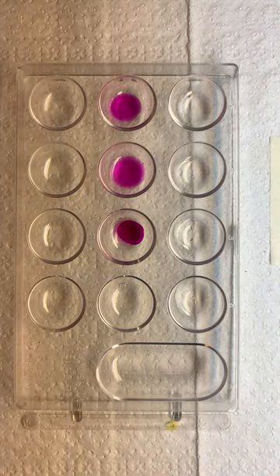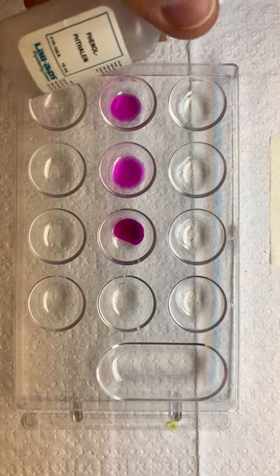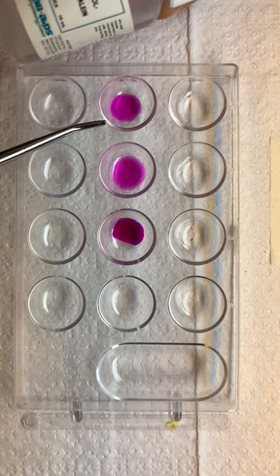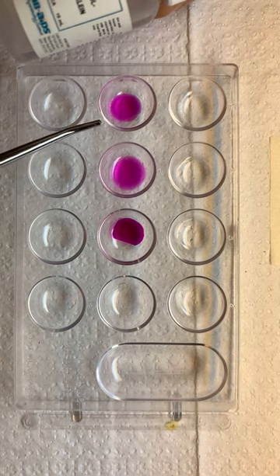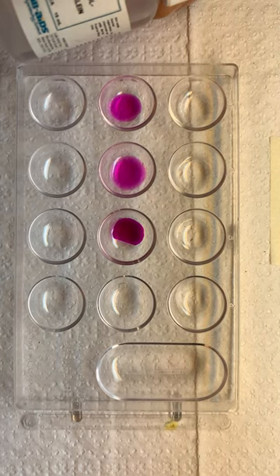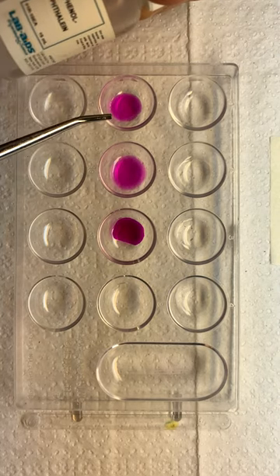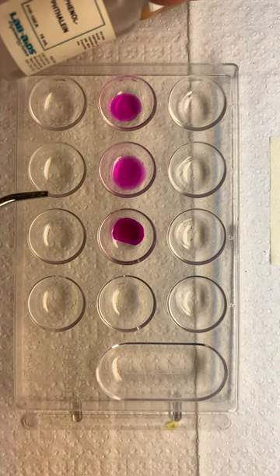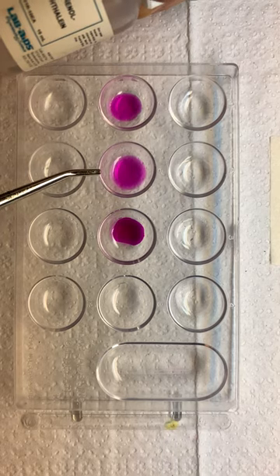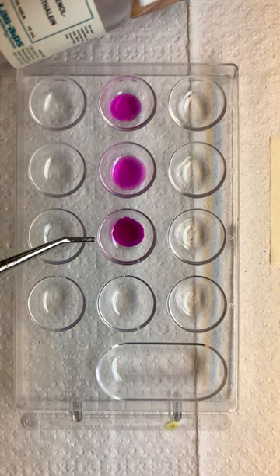All right. So where do you see the changes for phenolphthalein? We see the changes in these three wells — pH 9, 11, and 13. So we could say the range for phenolphthalein is between 9 and 13.